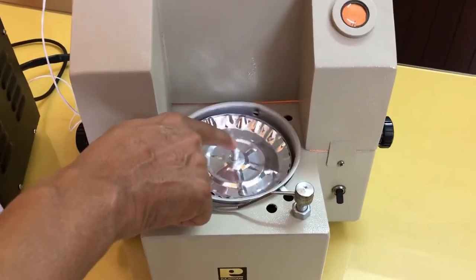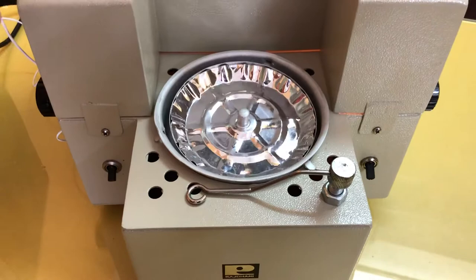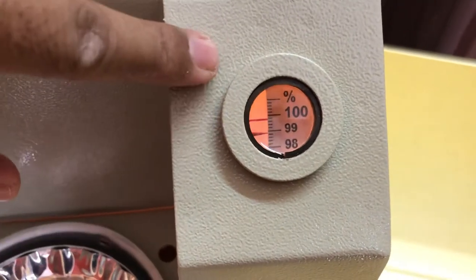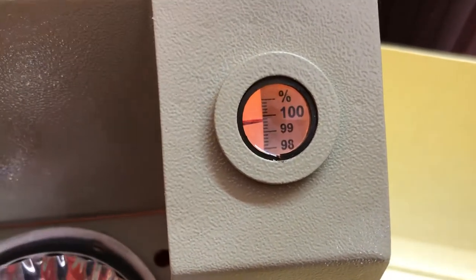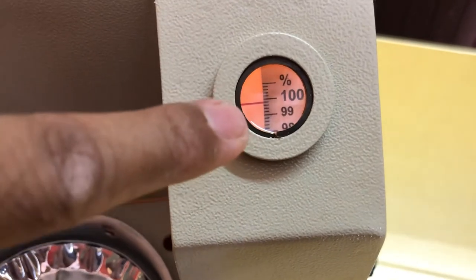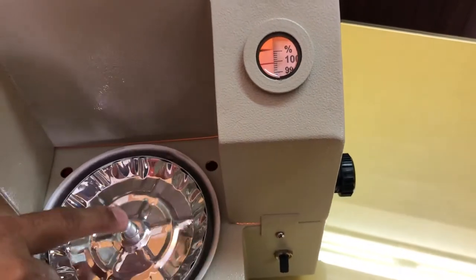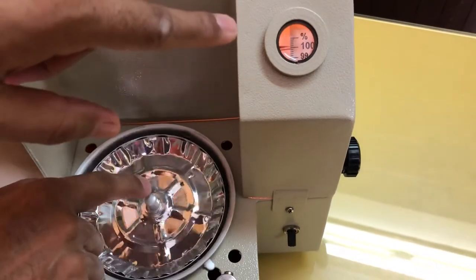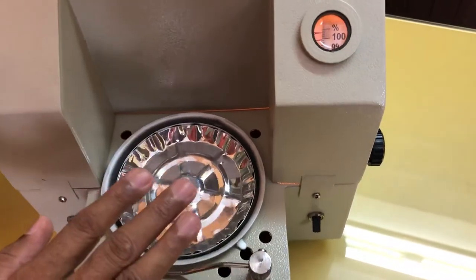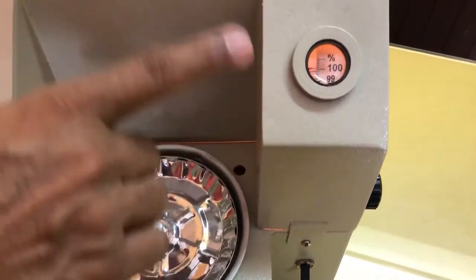This is the sample pan. To check whether your instrument balance is in proper condition or if there is any damage from transportation, you have to look at the display. This is a dial — you are viewing through the viewing glass. Three things are visible: the scale showing 100, a horizontal red reference mark on the left of scale 100 which is fixed, and this is the pointer. As I press this sample pan with my finger, that pointer moves freely. If this is happening, it means your instrument is in working condition — no damage during transportation. That pointer should move up and down freely.